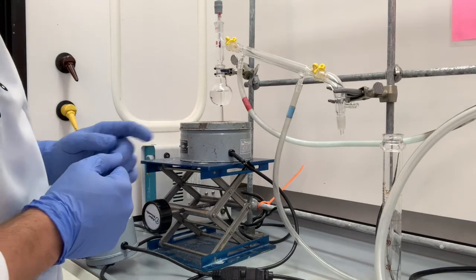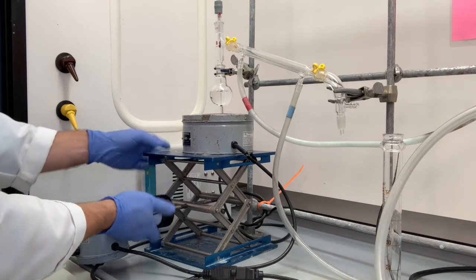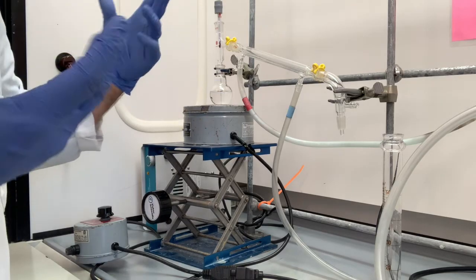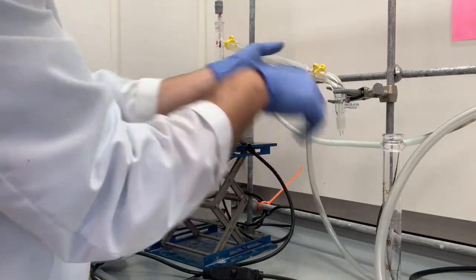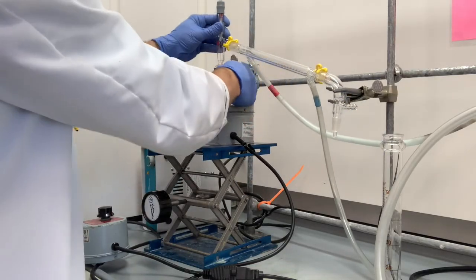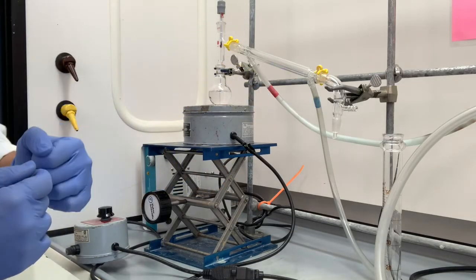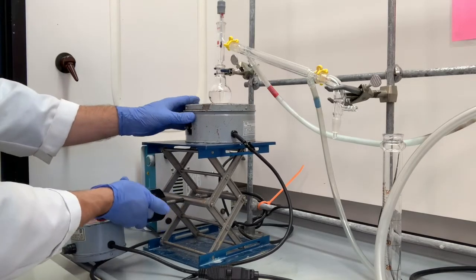Something you want to be really cautious of, these are plastic tubes. When you lift this thermowell, you want to make sure that that tube isn't touching. This can get really hot. That's its job, to get hot. So you want to bend the condenser inlet away. Because if you melt that tube during the distillation, you're going to have a big flood. All the water is going to go everywhere. It's going to damage the tube.